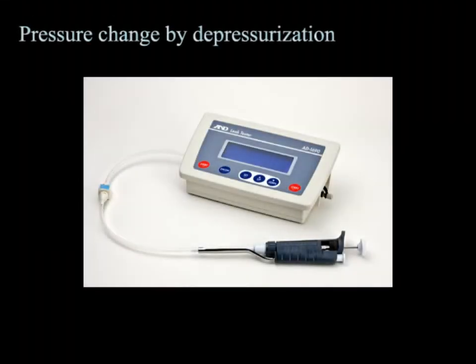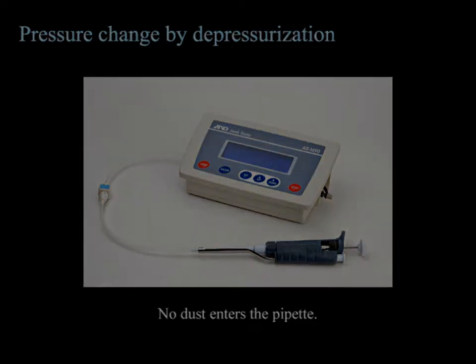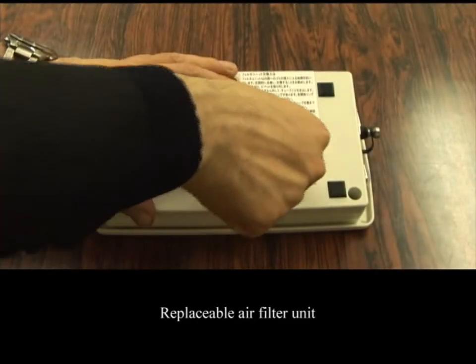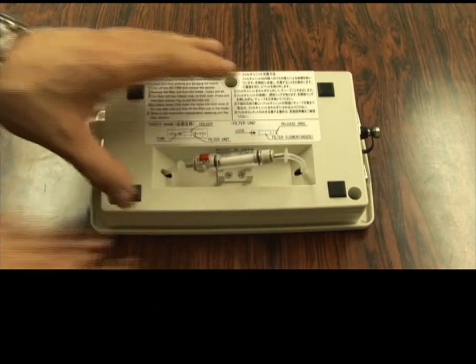The AD1690 detects air leakage by depressurization. That is, it changes pressure by evacuating air instead of injecting it, which ensures that no dust enters the pipette being measured. The AD1690 itself is protected from dust by an air filter unit, which you can easily replace and maintain yourself.